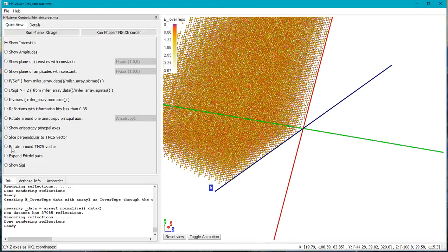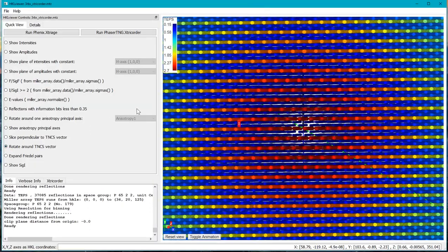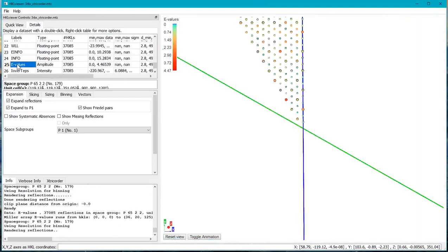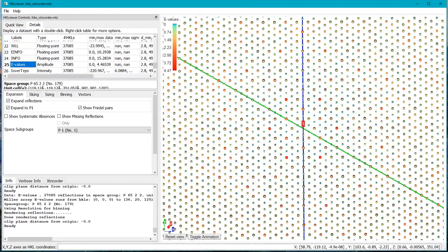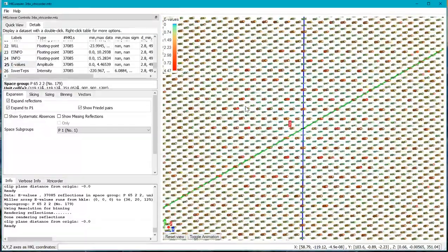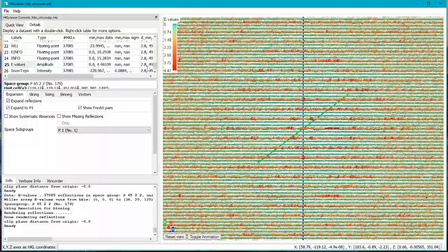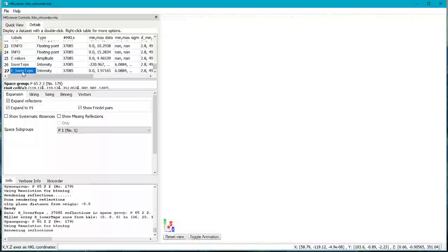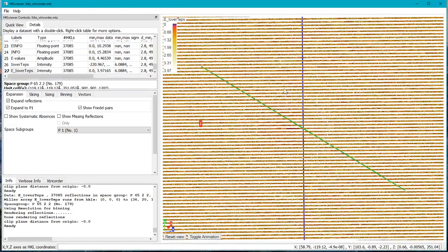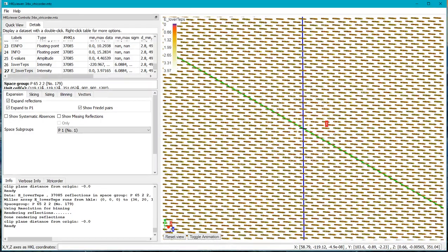So if we have a look at the rotate around TNCS vector and try and rotate these e-values around, we can do that by going here and clicking on the uncorrected e-values and rotate them as well. You can see that there are strong ripples in the data corresponding to the TNCS correction. Now if we go to the corrected e-values and rotate those around, we can see that there are no ripples in the data. So that concludes that we actually apply the TNCS correction to the data, and this data would be suitable for using in a molecular replacement search.